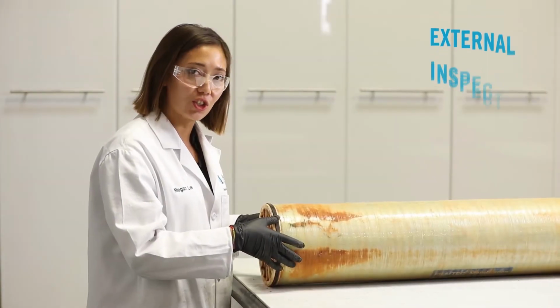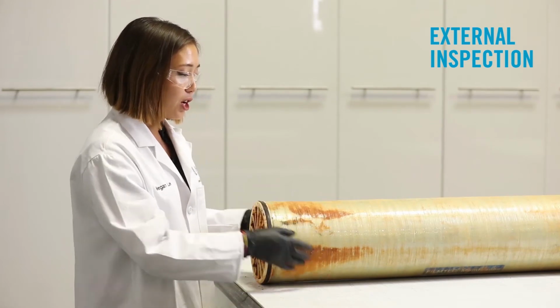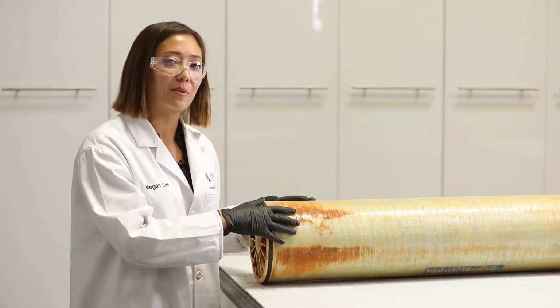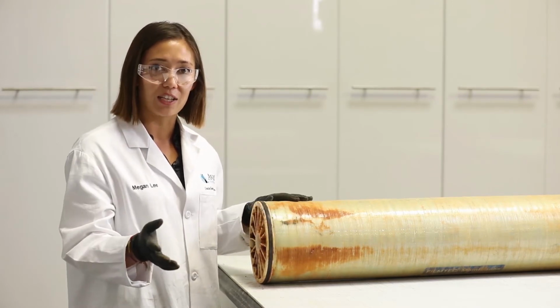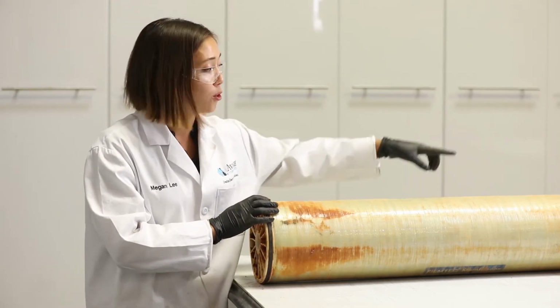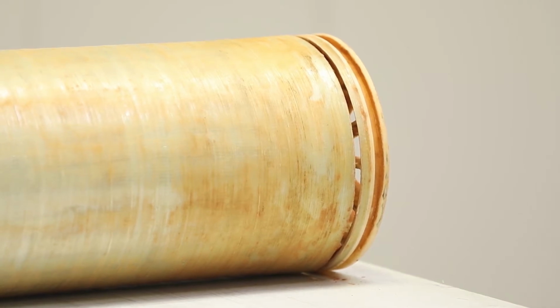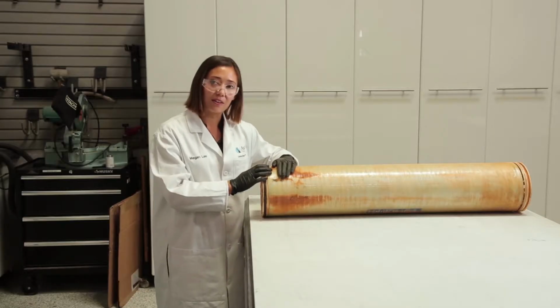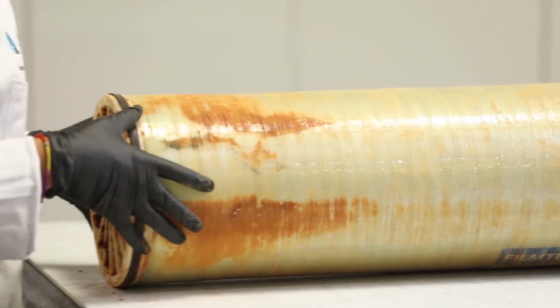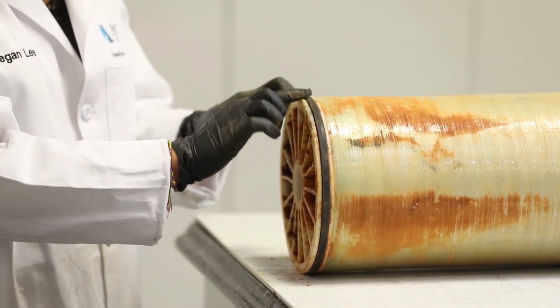Now we'll move on to our external inspection of the element. First, we'll take a look at the fiberglass casing. What we're looking for here is any mechanical damage, which might mean that the element has been exposed to pressure that's greater than the manufacturer's specification. We'll note that there is some mechanical damage with cracking of the fiberglass casing towards the concentrate end of the element. Additionally, we see foulant material coating the exterior of the casing, which means that water has been allowed to pass around the element. The most likely place that this would occur is at the brine seal.